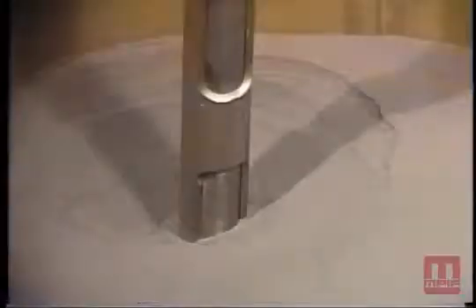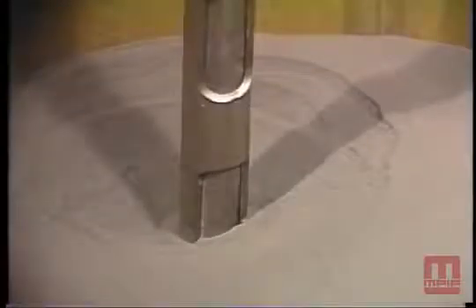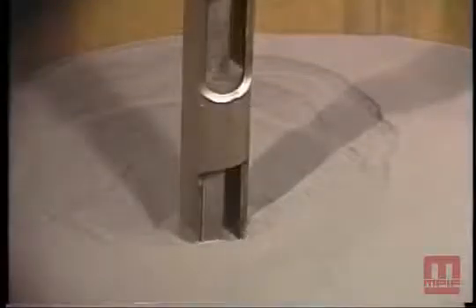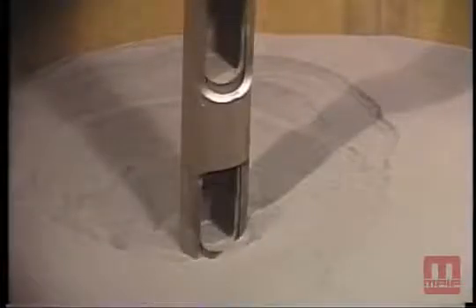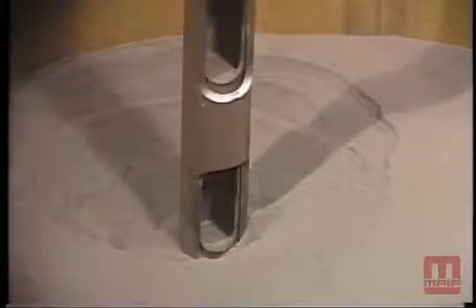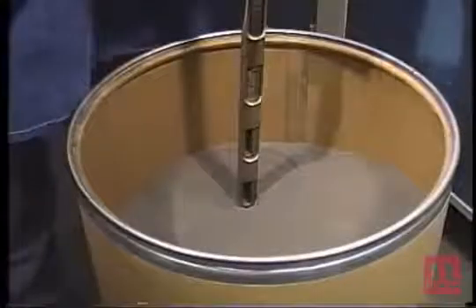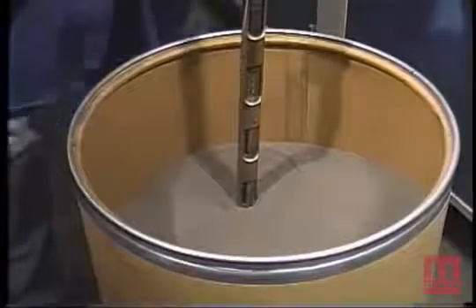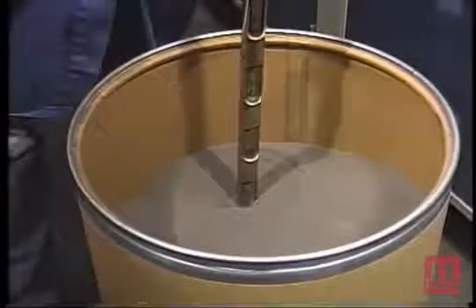The keystone sampler in the closed position shall be inserted into the center. The sampler is then twisted to the open position to allow powder to flow into the sampler tube. When the tube is filled, the sampler is once again twisted to the closed position.